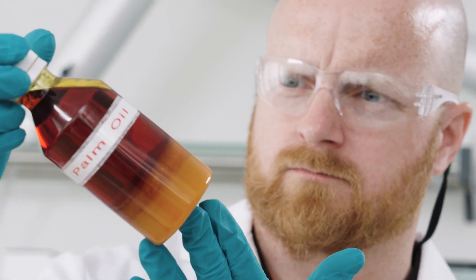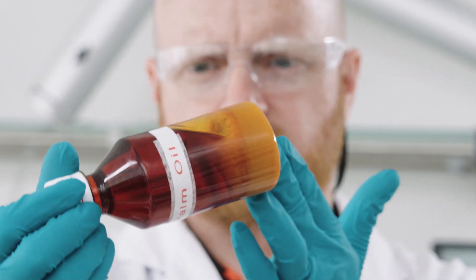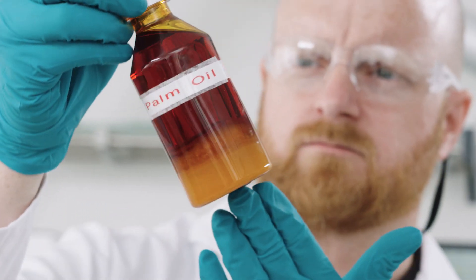In case of too high element content, too high viscosity, inhomogeneity, or undesired components, you need to pretreat your sample. Typical examples here are palm oil, VGO, or animal fat. If sample pretreatment is necessary, there are a number of points to be considered in order to achieve optimum results and to avoid any kind of hassle.